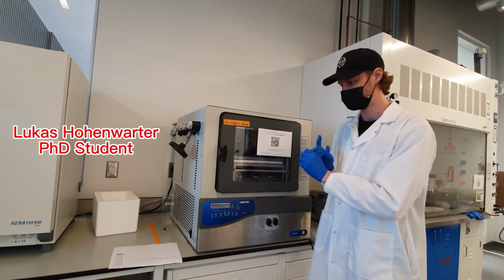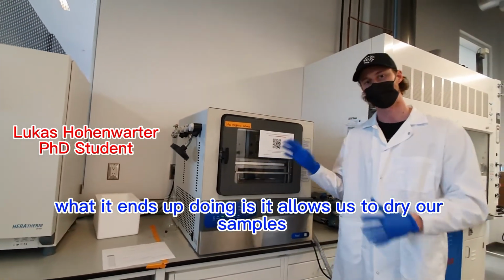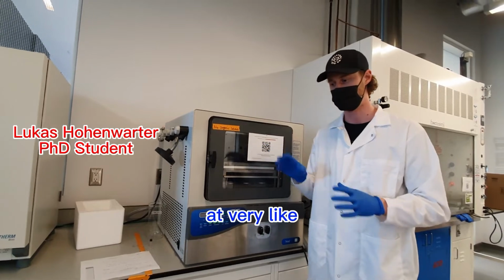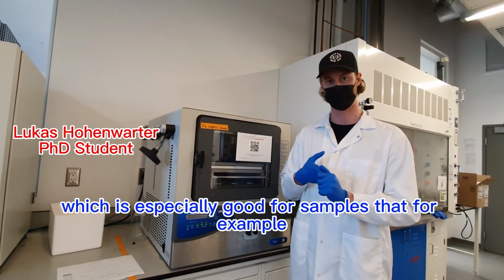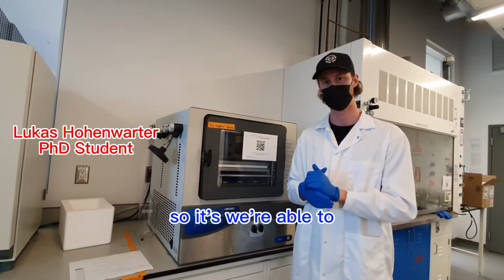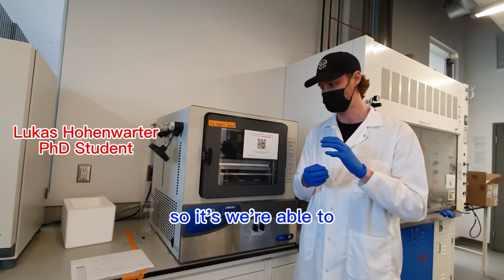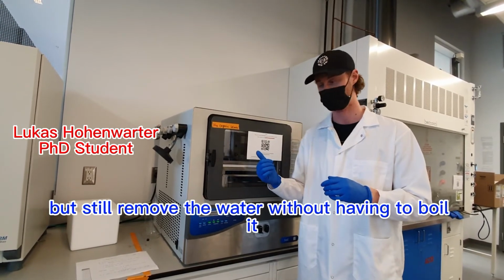What it ends up doing is it allows us to dry our samples at very moderate conditions, which is especially good for samples that, for example, are sensitive to heat. So we're able to preserve those samples but still remove the water without having to boil it.